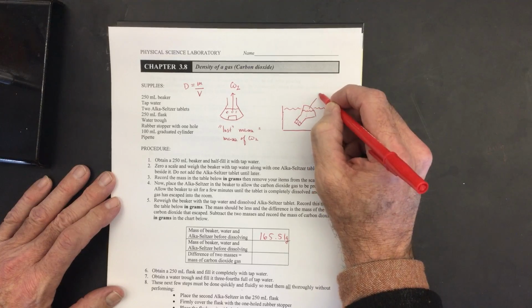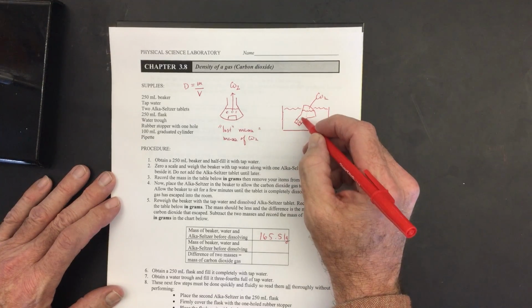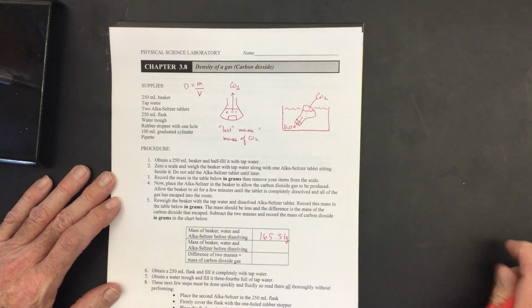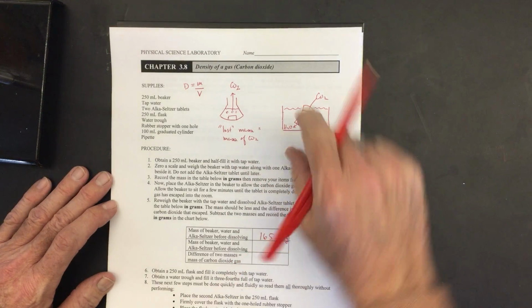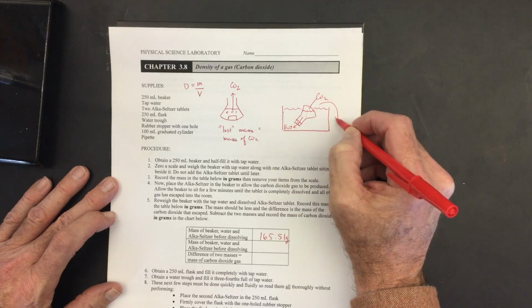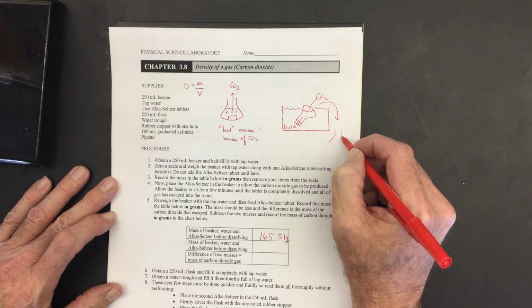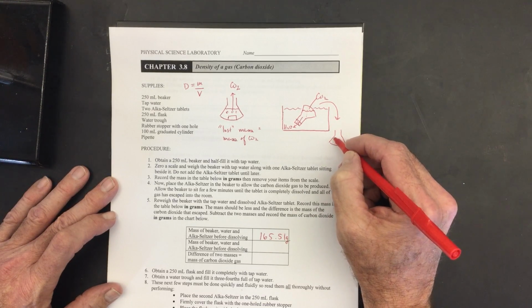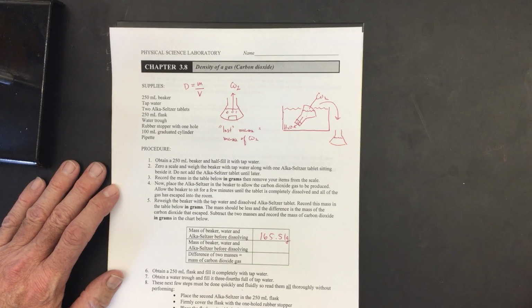So at the top of here, this is going to be carbon dioxide. Those bubbles will be collected, and then the water is going to be pushed out as the bubbles are collected. Then what I can do is take this flask and turn it right side up, so it's sitting on the countertop. And I'm going to pull out the rubber stopper. And of course, what's going to happen is there's going to be some water that was pushed out.